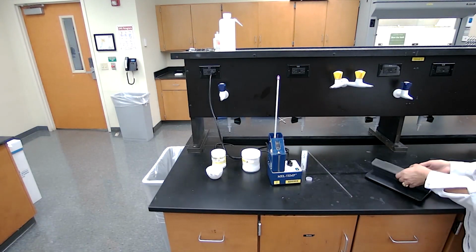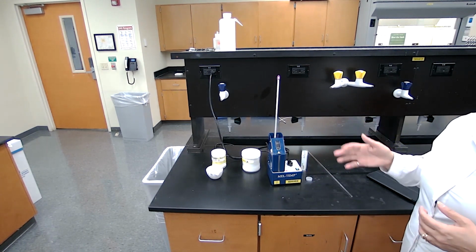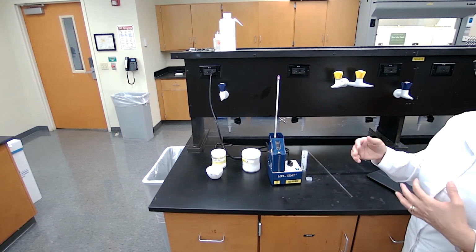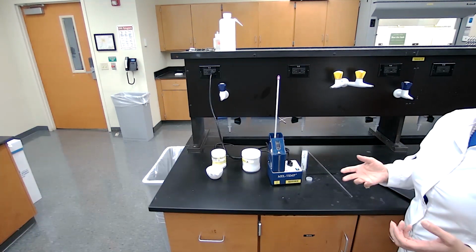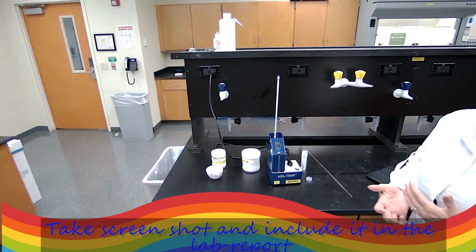After the melting point, we're not going to have any conclusion at this point based on the melting point, because it could be a ketone, an aldehyde, an alcohol, or a carboxylic acid. Next, we are going to do the solubility test.